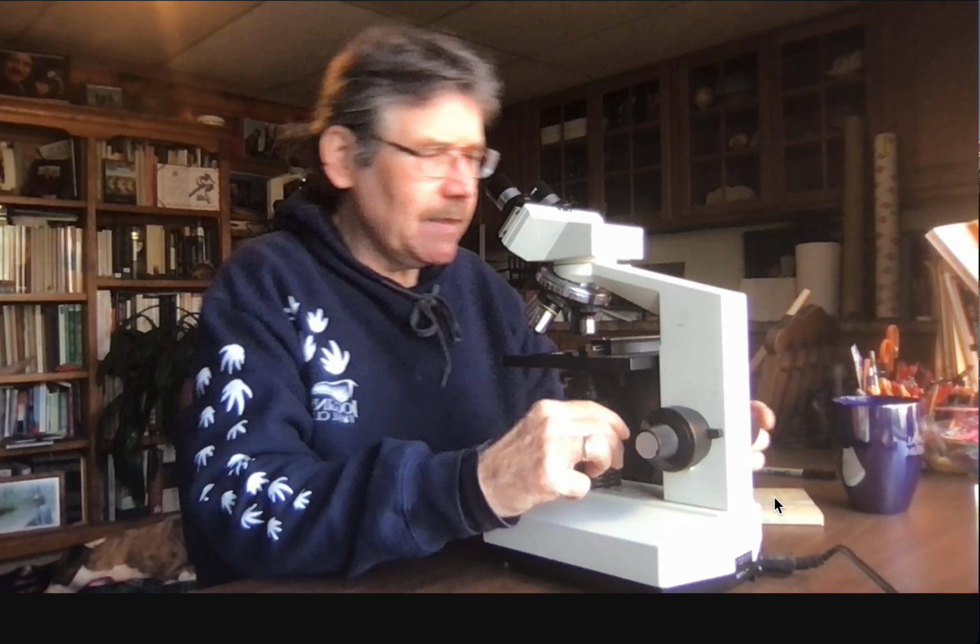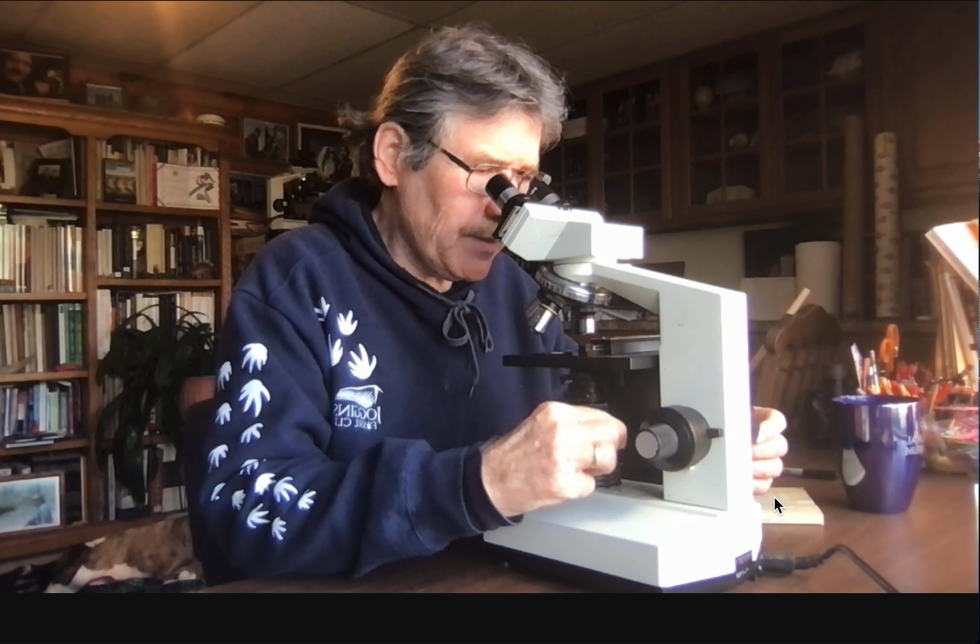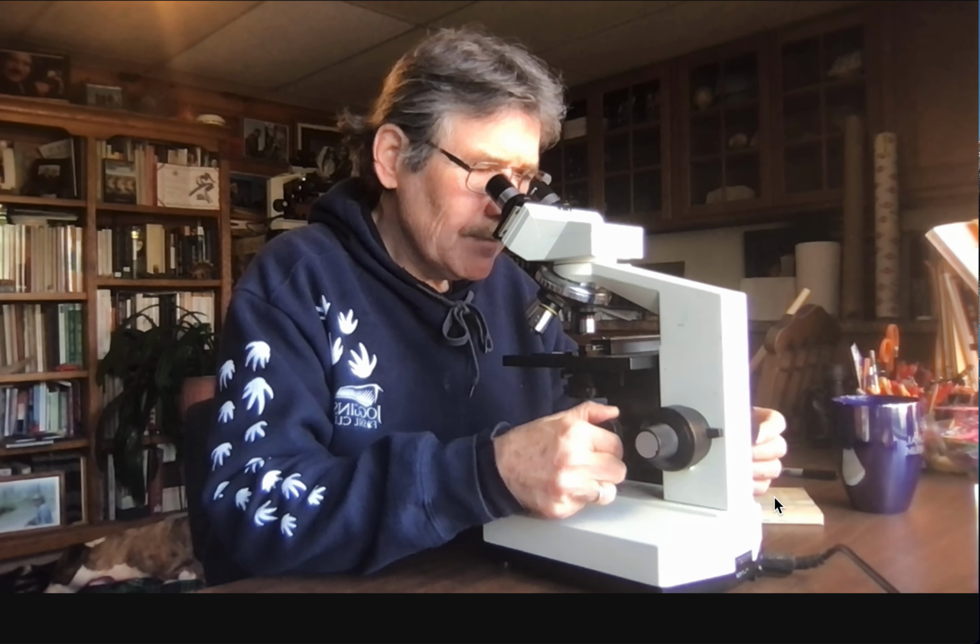So we move that condenser lens up and down, and you'll notice it makes a difference. Generally speaking, when you're at higher mags, you want to be right close to the top, but then drop it down a little bit. You'll learn in another class exactly how to adjust this perfectly. It has to do with physics and some things about the objective, so we're not going to go into that.